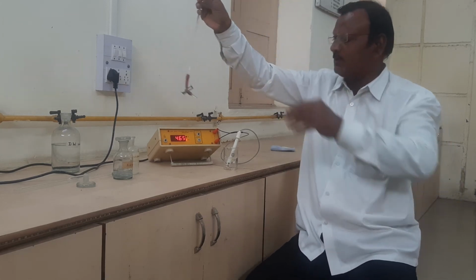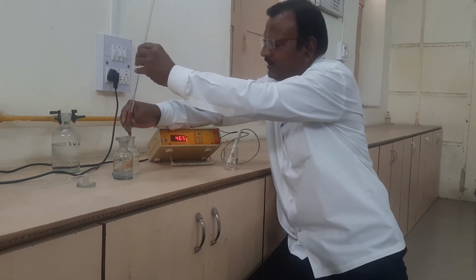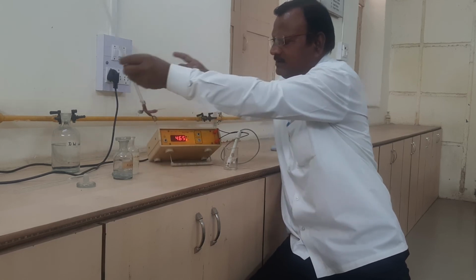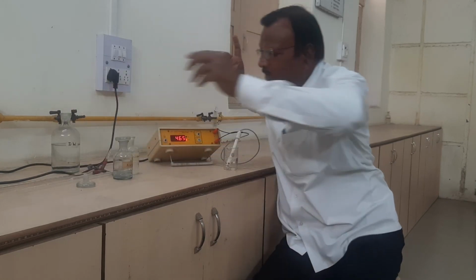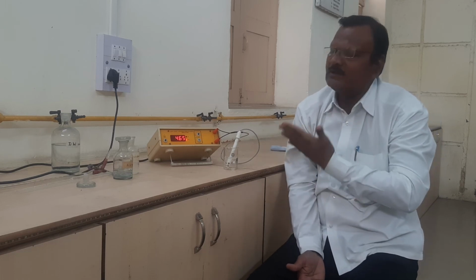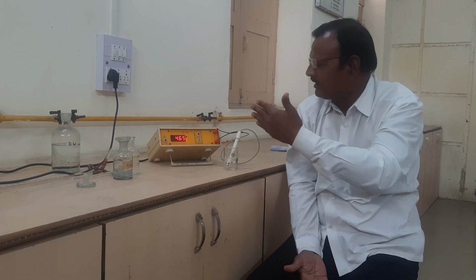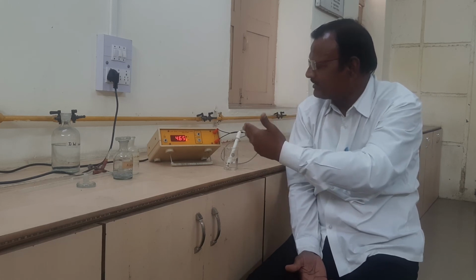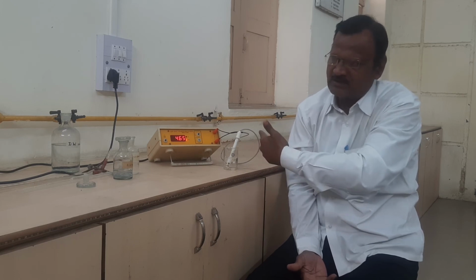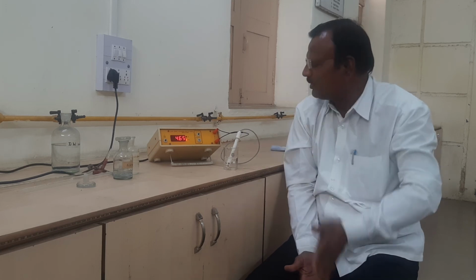Then we have to stop this titration. Actually, we have to add 0.5 ml every time, up to 15 ml of strong alkali, then stop here. In the observations, the observed conductance is high, then decreases, then it increases, and the second equivalence point will appear, then again it increases.